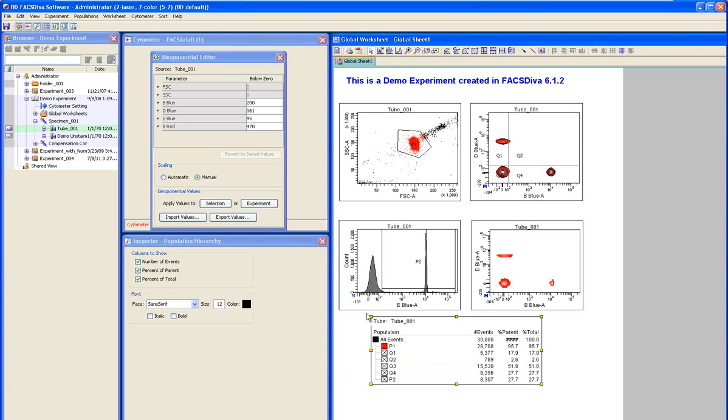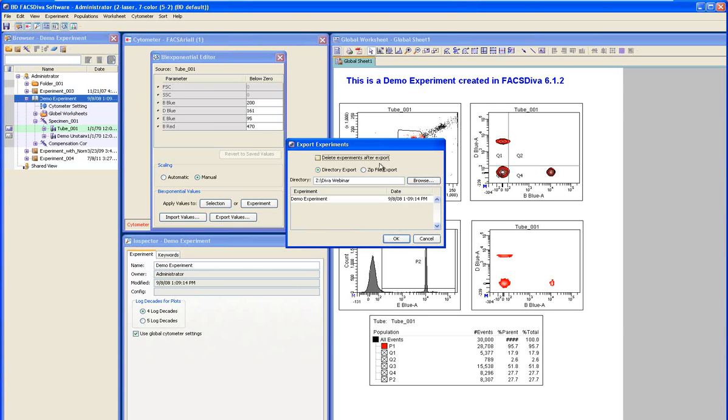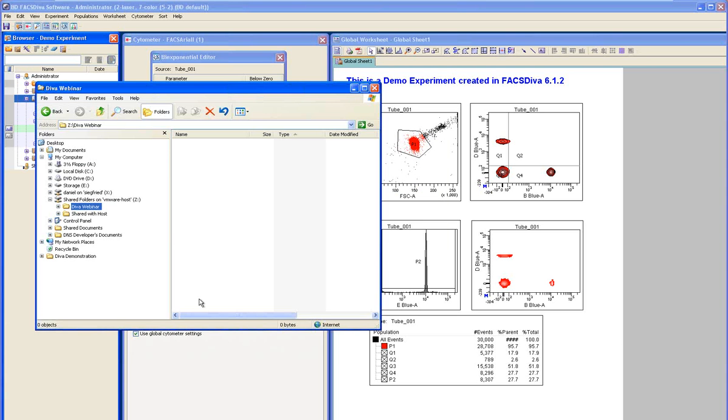So once you've decided to go to FCS Express, you would simply select the experiment, and then under the File menu, there's an Export Experiment. And there's also an Export FCS Files. So the first thing we're going to do is Export Experiment. You select your folder where you're going to export to, and OK. And what's happened now in the export, I'll show you what that folder actually looks like now.